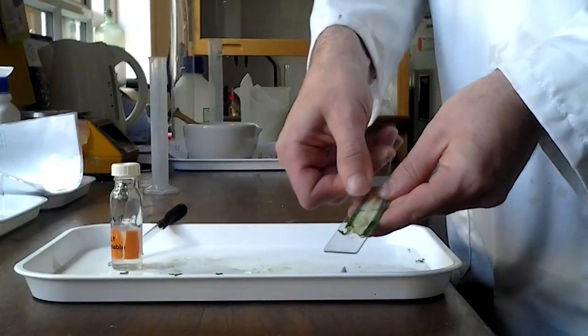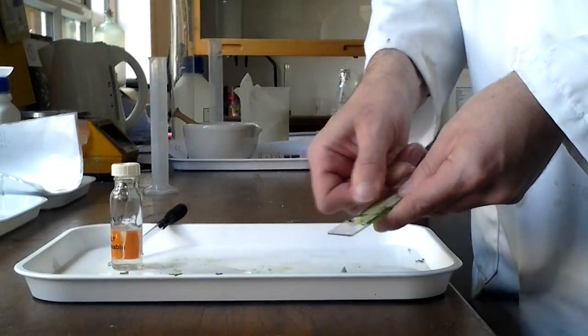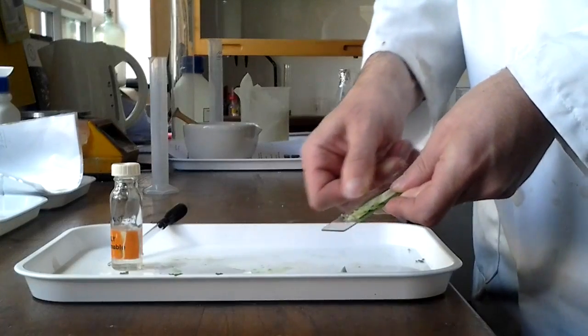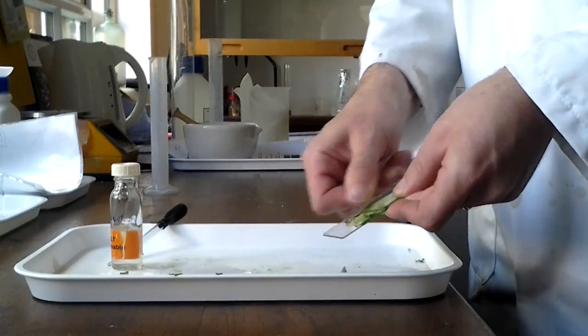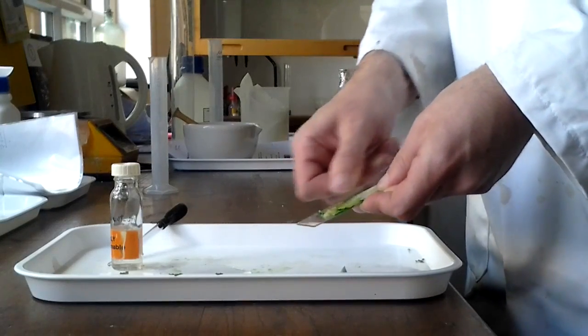So you might see that we're starting to get a bit of juice moving there. You don't have to press massively hard. You'll get a bit of juice being produced. What we want to collect is not the solid material that I'm mushing up, it is the green liquid that's coming out.